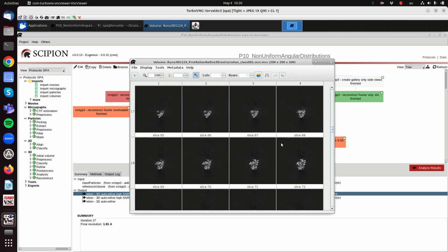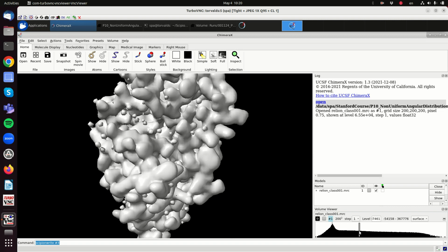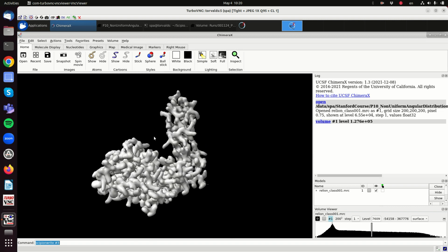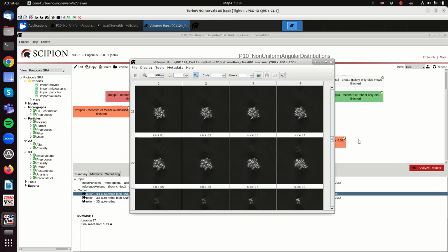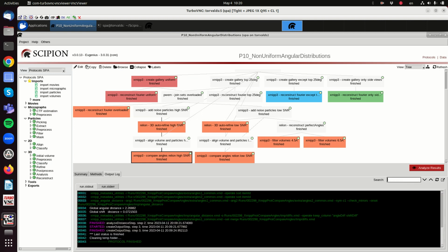So, and we can check in 3D. Having an overloaded direction in principle shouldn't create any problem if we have enough signal to noise ratio. So here we see that the structure is correct, and we can check for how many images we have made a mistake. So you see that our uncertainty is in the order of 2 degrees, and in shift it is less than a pixel.